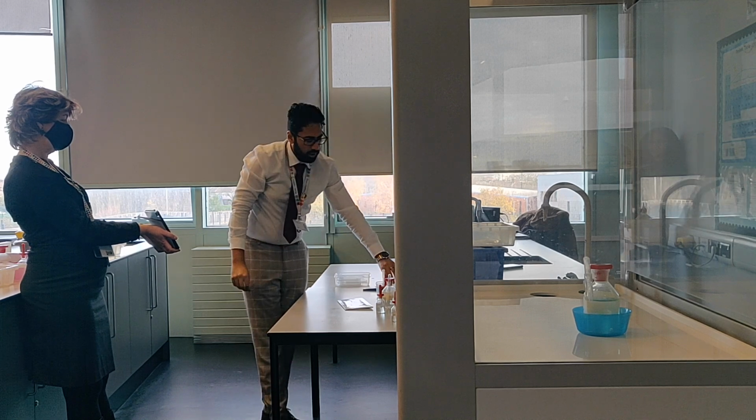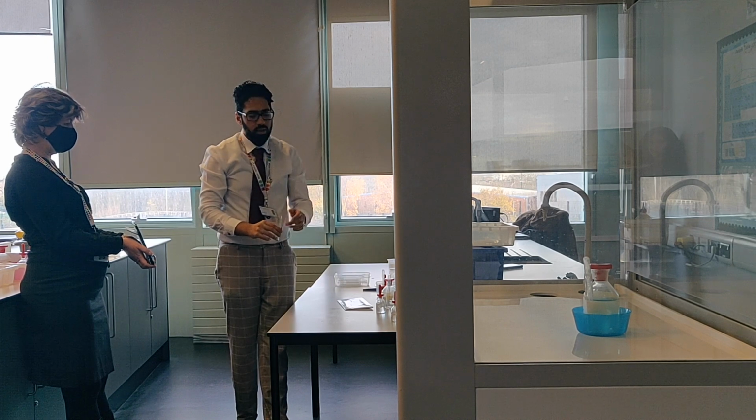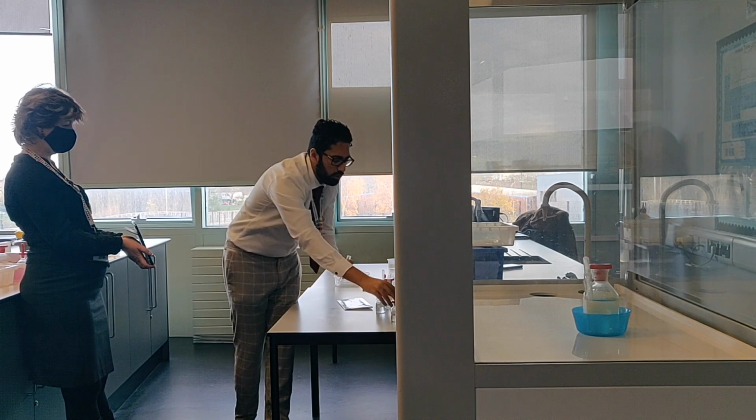Okay, and we'll do exactly the same thing with bromide, silver nitrate, nitric acid, with concentrated ammonia, and I just want you to see the difference between them.